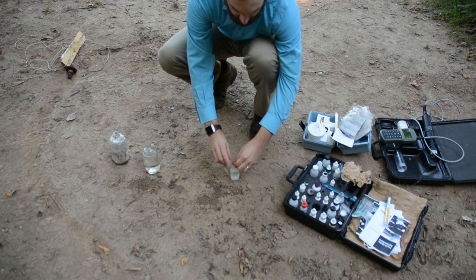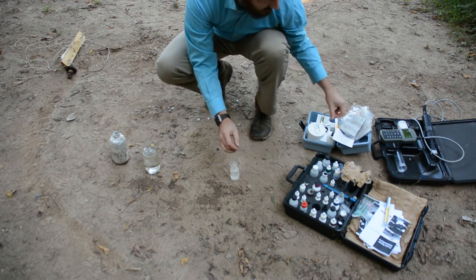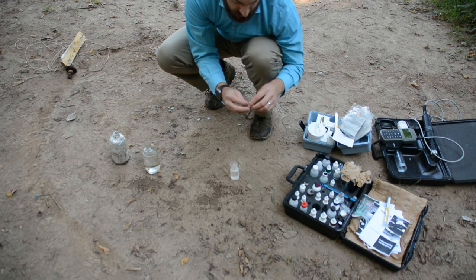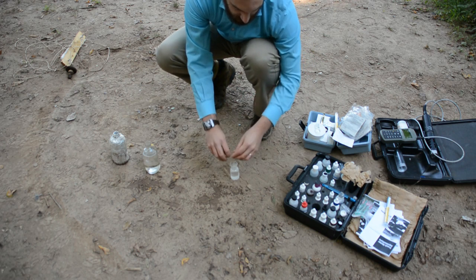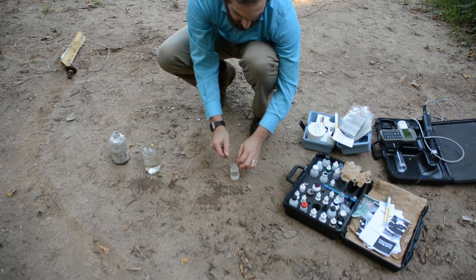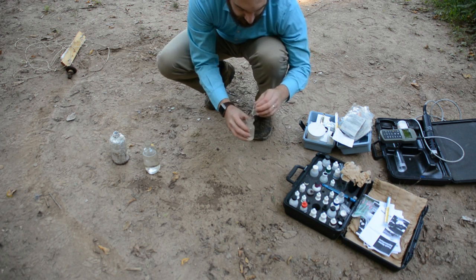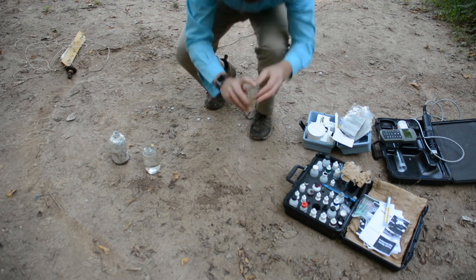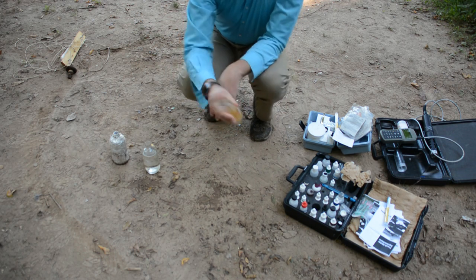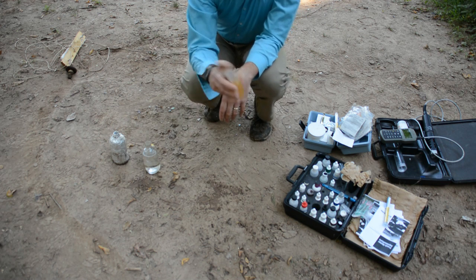So I add that chemical reagent, all of it. And now the second chemical reagent, all of that. Now we will cap it. Get everything mixed up. Cap it, invert it a couple times, shake it up, and it's going to turn yellow if oxygen is present. So no matter what level, it will turn yellow.